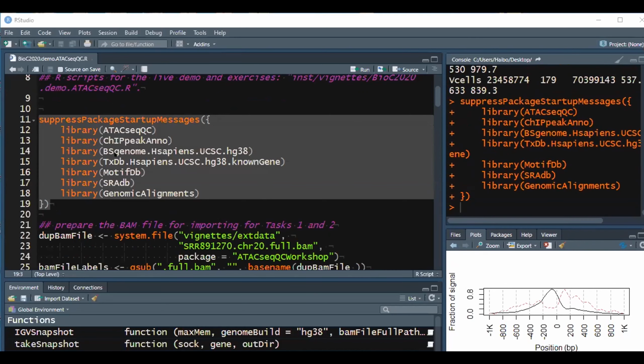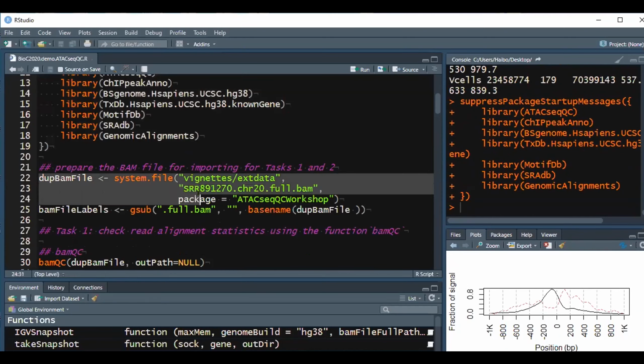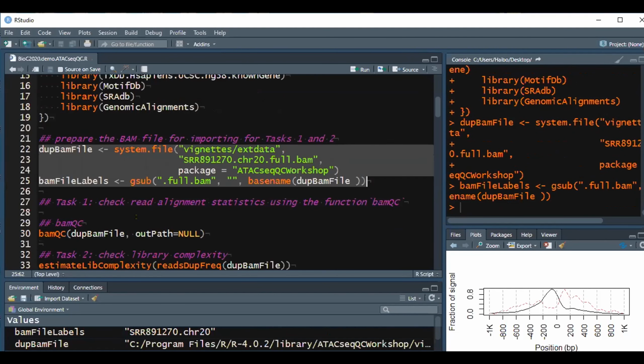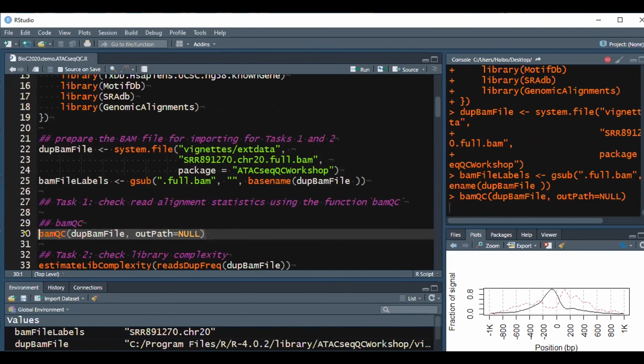After loading those packages, we can read the BAM file, which has duplicates marked. Then we can run the bamQC function to check the mapping statistics. This function is kind of slow. It may take a while to finish, even though we only use the chromosome 20 alignment file here.